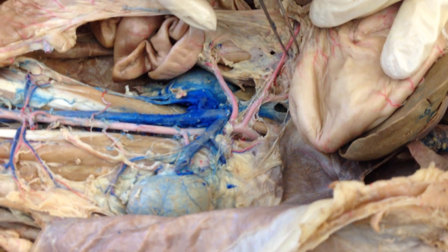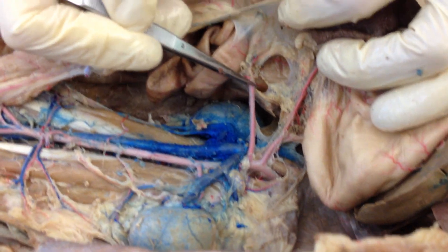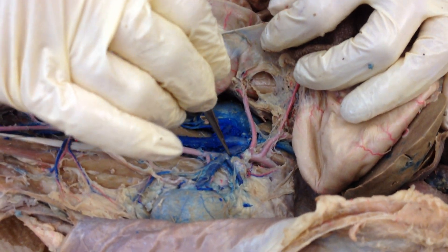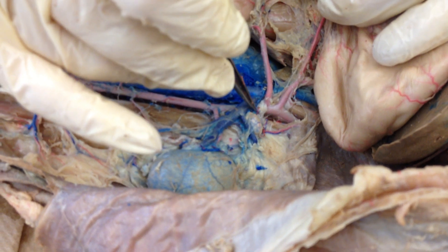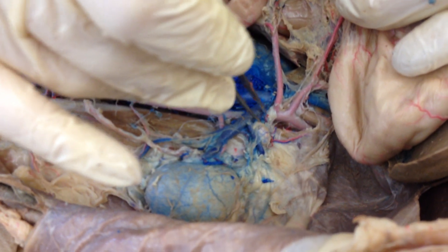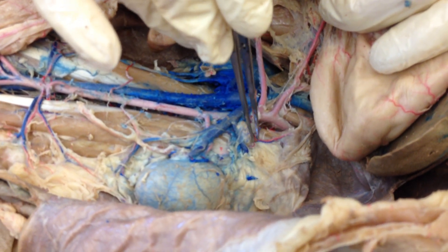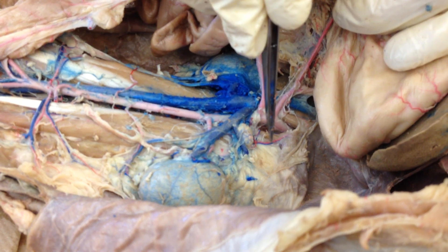All of these branches are feeding those particular organs. The second major branch coming off the aorta is the superior mesenteric artery — it supplies oxygenated blood to the small intestine and the upper reaches of the large intestine. The next vessel: this is the adrenal gland and there's your kidney. That little red structure is the adrenal lumbar artery, and the blue one is the adrenal lumbar vein going right up over that adrenal gland. These beautiful little phrenic arteries and veins go from the adrenal gland straight up and feed blood to the diaphragm.